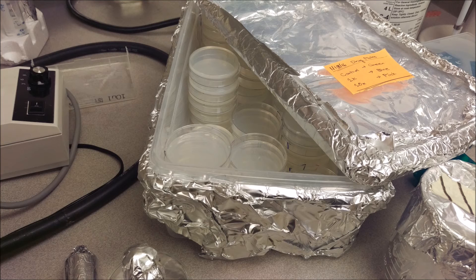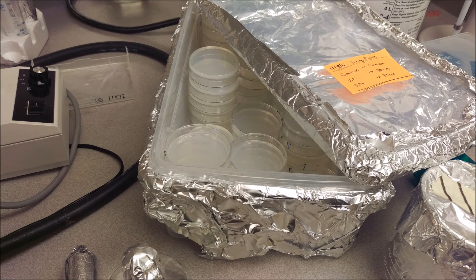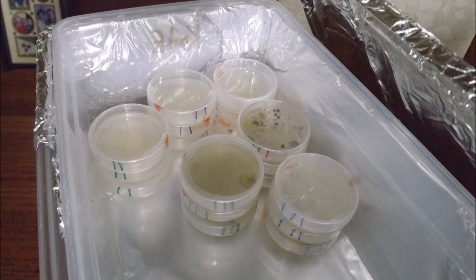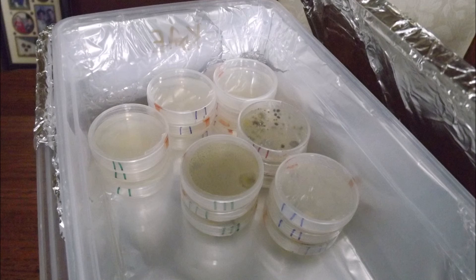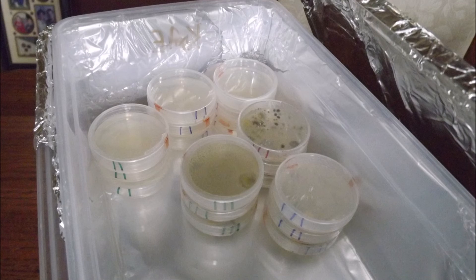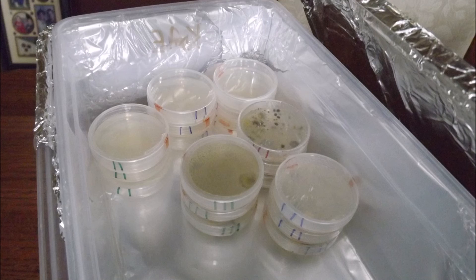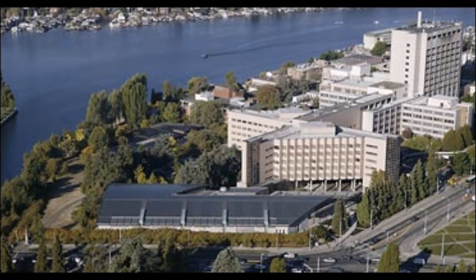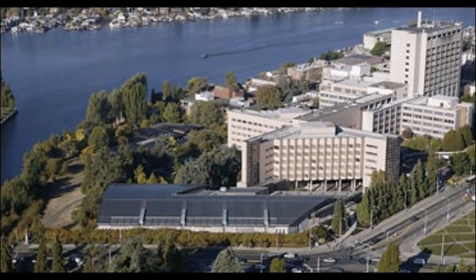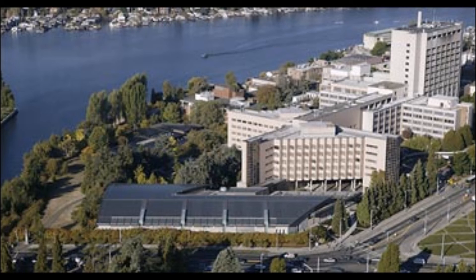Looking towards future studies, I would say the most important aspect would be to keep the worms in a very sterile environment. I still don't know if TA65 will actually extend C. elegans' lifespan, but this experiment was not a loss by any means. The experience I gained at the Caber Lane Lab was something I'll never forget and will take with me into my career.